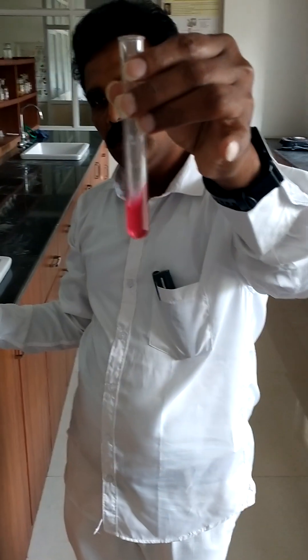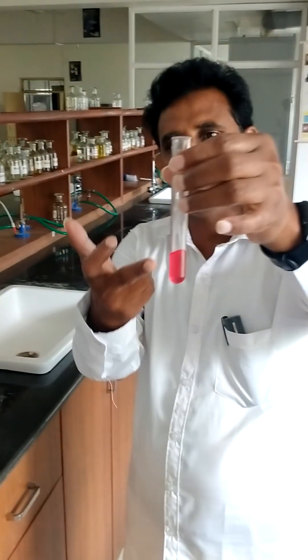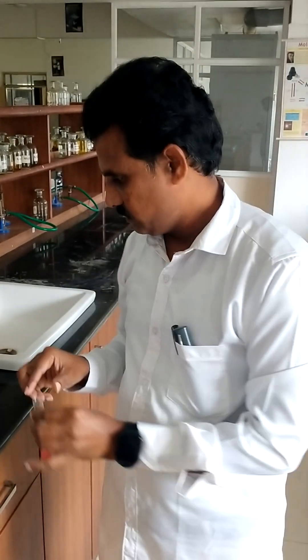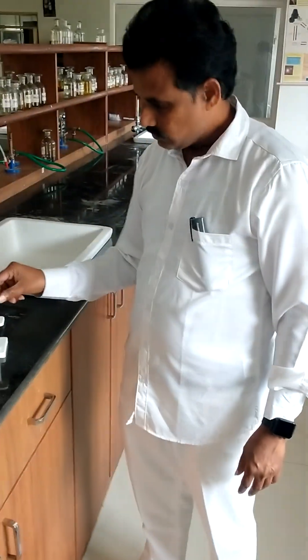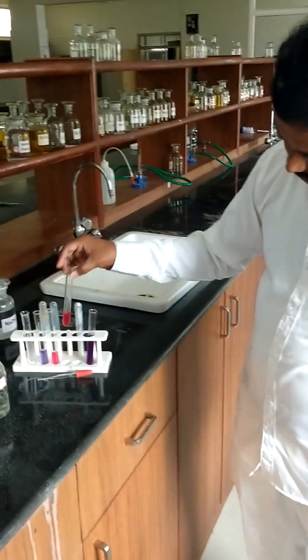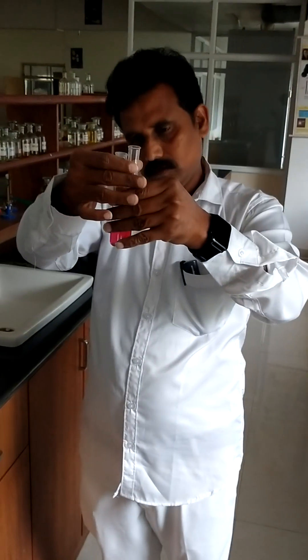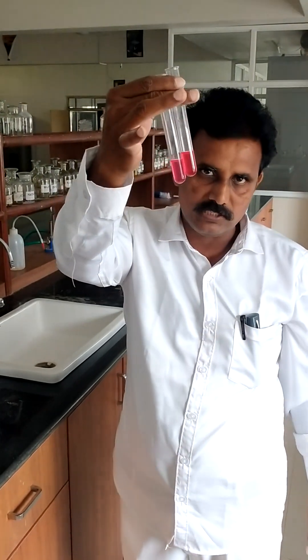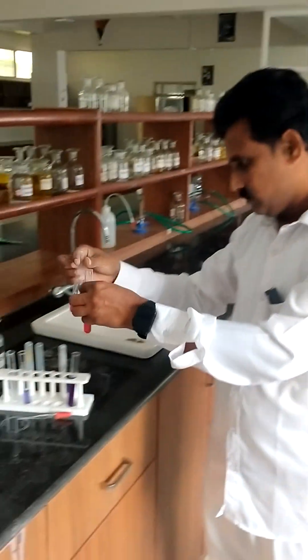You can observe this red color. This is due to flavylium formation — flavylium is red in color, that is the reason it exhibits red color. The natural indicator shows the same color in both strong and weak acid — this pink or red color in both cases.